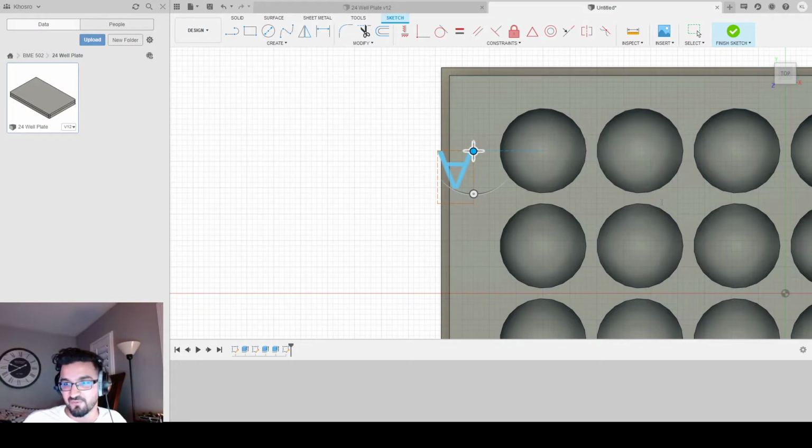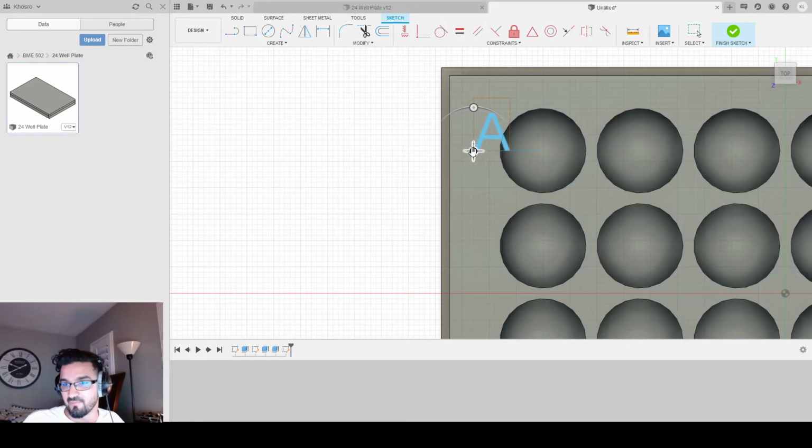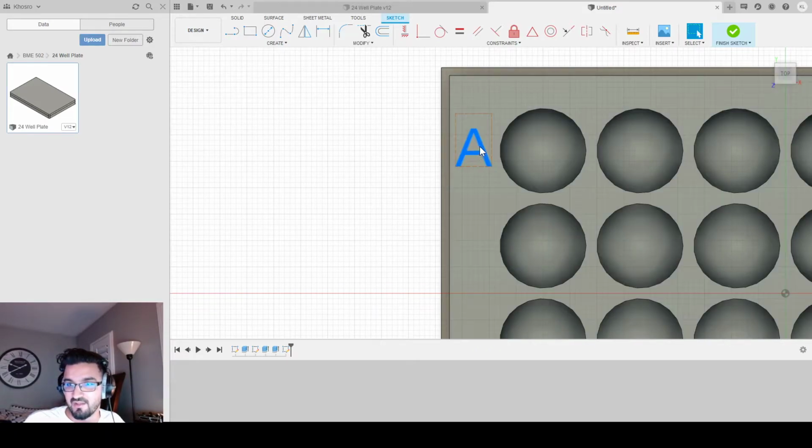So if I fill my text with the first option and say I want text A for the first row, you could do whatever you want. You don't have to call it A, B, C, D, E, but that's the standard. But this is CAD, and you can do whatever you want. I'm going to rotate this by 180 degrees so it's right side up. And I'm going to grab the circle, and I'm going to drag it to where the A is basically lined up with that plus here. And I'm going to click OK. So now I have an A here, exactly where I want it to be.